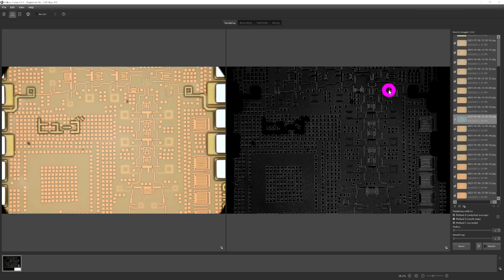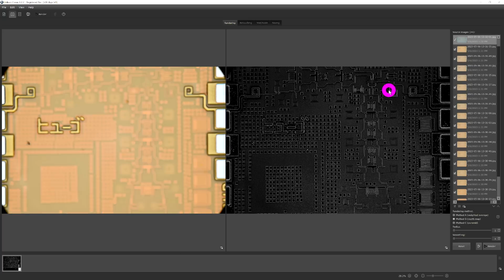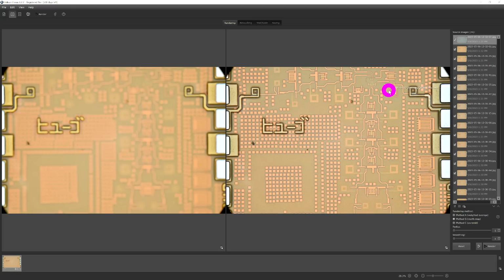Now, one other thing you can do when you do this is that you can estimate the actual depth of every layer. So you could create a quasi 3D picture. And in fact, it does that. You can already see how much better this looks and how everything is in focus. Let's go ahead and try and save it.